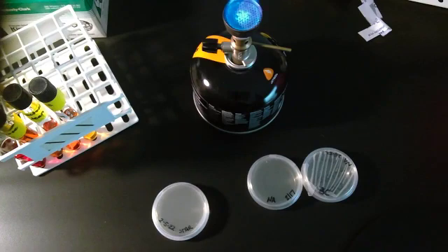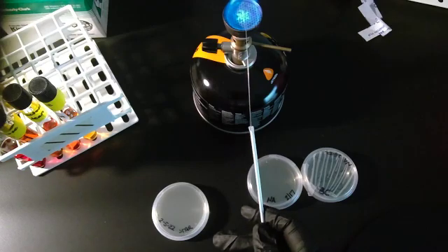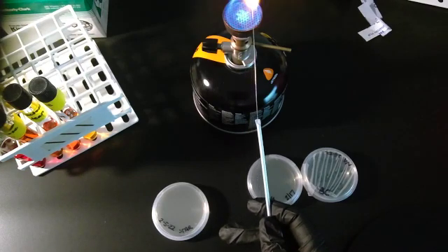With the way that we do this experiment, in lecture, with chapters 9 and 10, we talked about incineration. One of the things that I mentioned was that we do this in the lab with our inoculating tools because we put them directly into the fire.